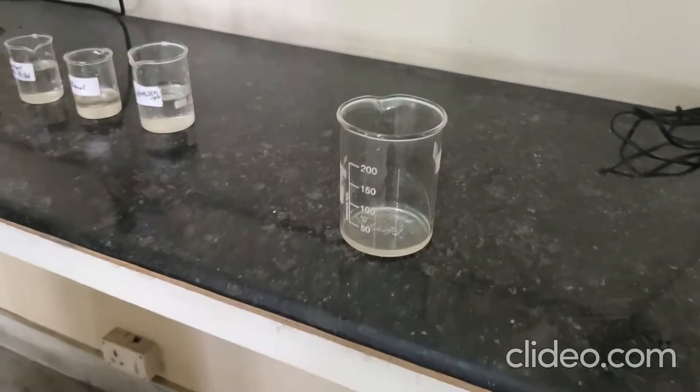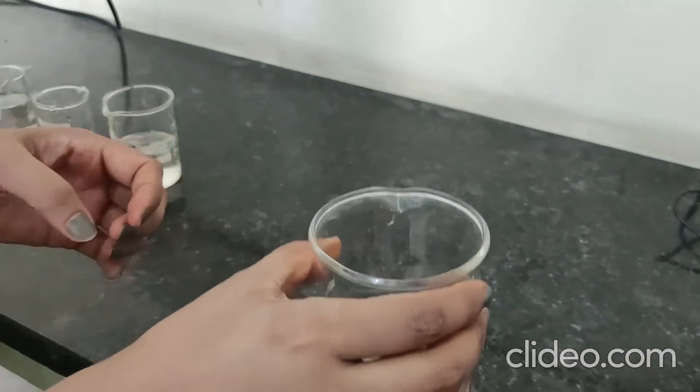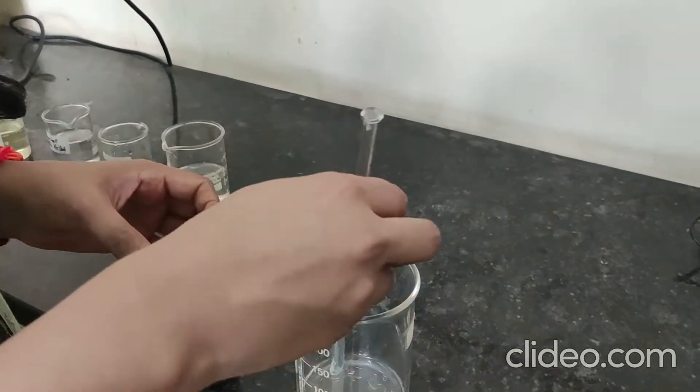Now mix the solution and put it on the water bath for 1 to 2 minutes using stirring.